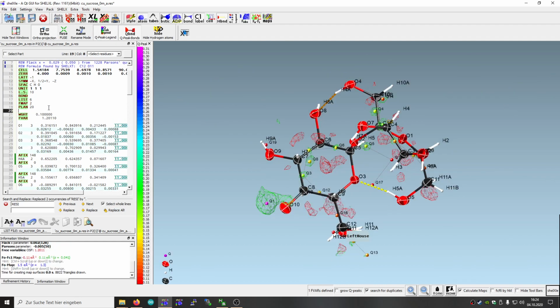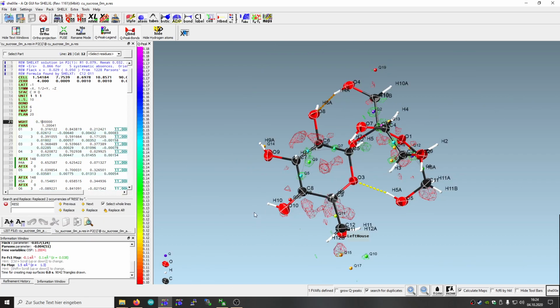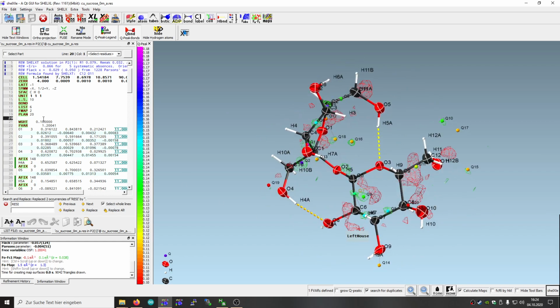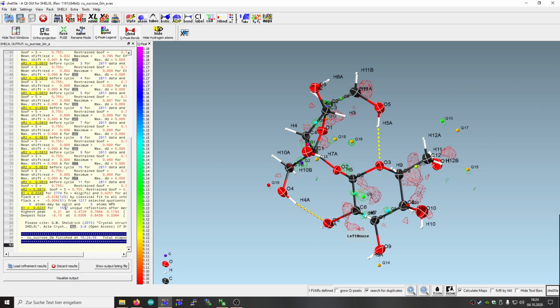So HFIX 148 and O10. Now this should work, and it did. So again, this is completely solved. So let's try if we have any extinction. Probably there's not much of it. Let's see.